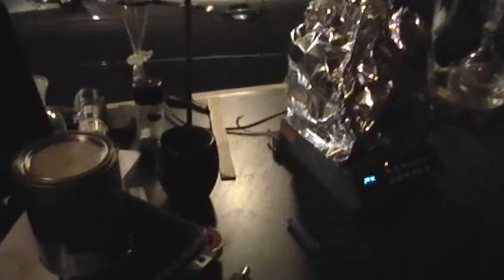Most of the other junk sitting around here is just Ryan and I killing time, waiting for this thing to get rolling. And now that it's rolling, we're taking video.